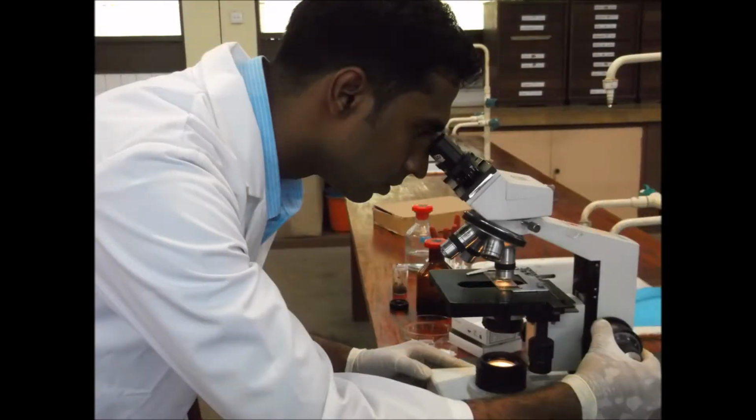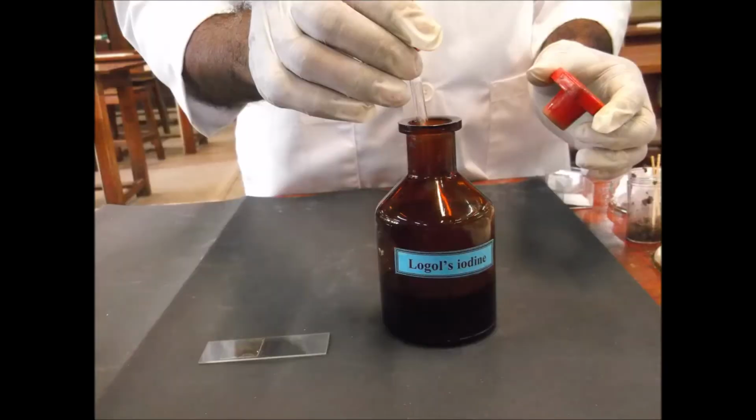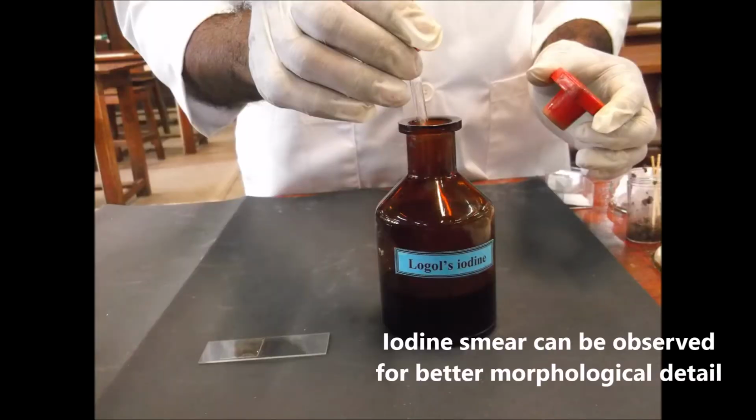You must examine under the microscope the same way as described for the direct wet smear. Systematically scan the cover slip area first with the 10 times objective. Use the 40 times objective if something suspicious is seen for a more detailed study. You will be able to see any eggs present easily in a very clear background. If necessary, you can add iodine to enhance morphological detail.